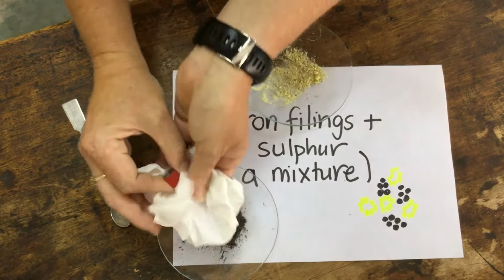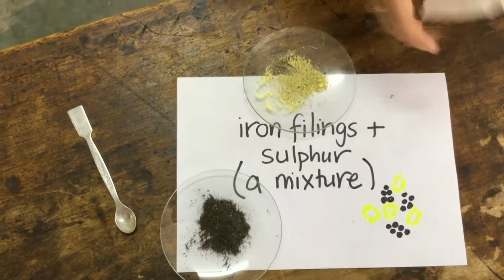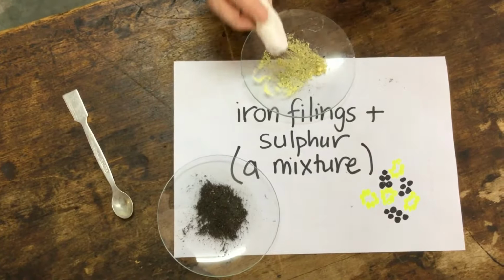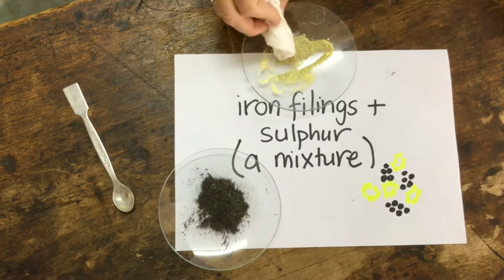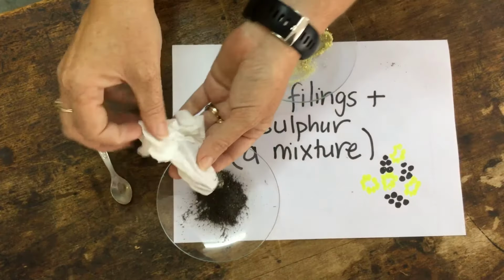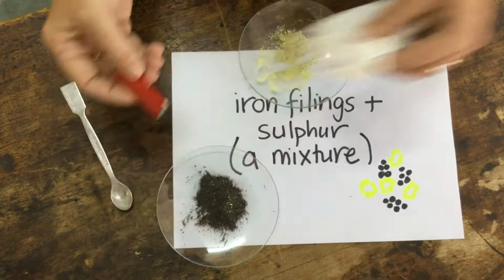And I can keep going and sift this out and remove some of the yellow sulfur. Eventually, you can see it's a little bit dirty from some of the impurities in the iron, but I can remove most of the iron filings and I can separate these two substances.